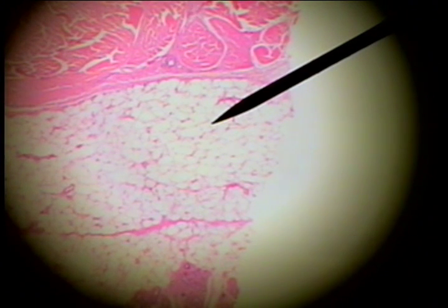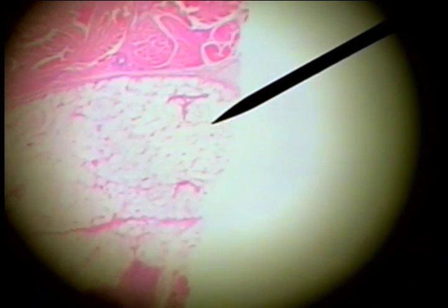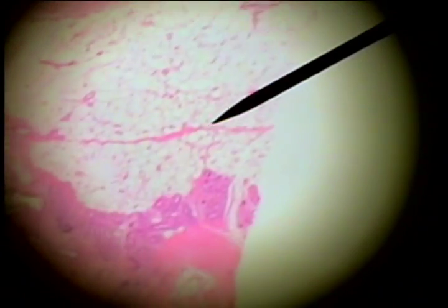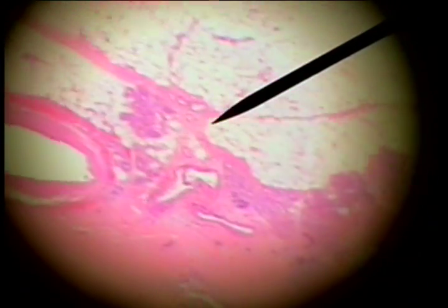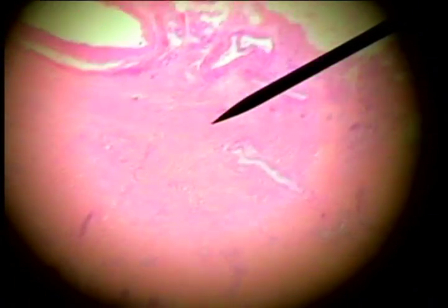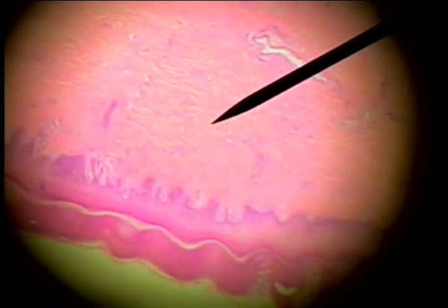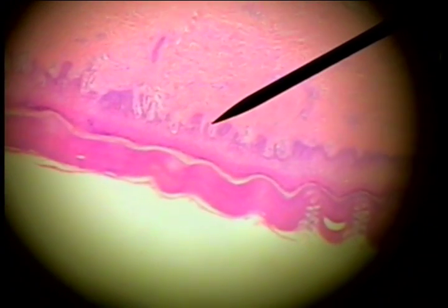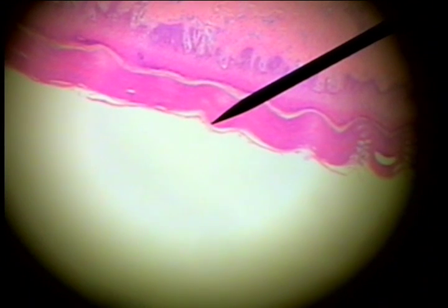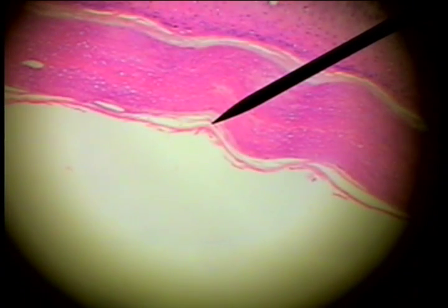This tissue is thick skin. The deepest layer here is the hypodermis, composed of much adipose and a loose connective tissue. Then this is the dermis, composed of dense irregular connective tissue. From here to here is the epidermis, and if we look at the epidermis at a higher power, we can distinguish the layers.